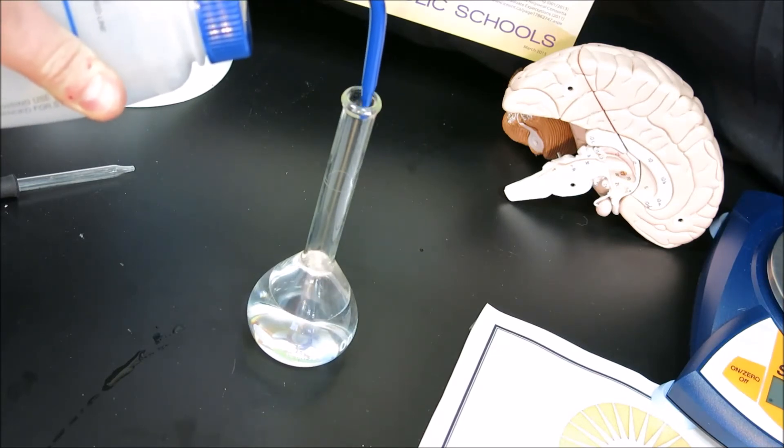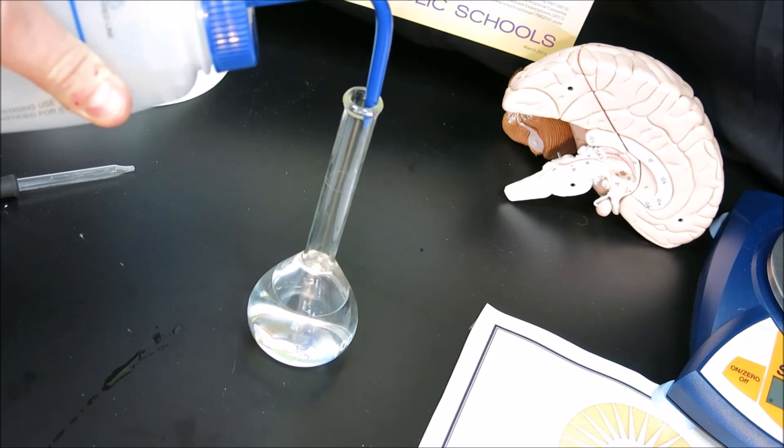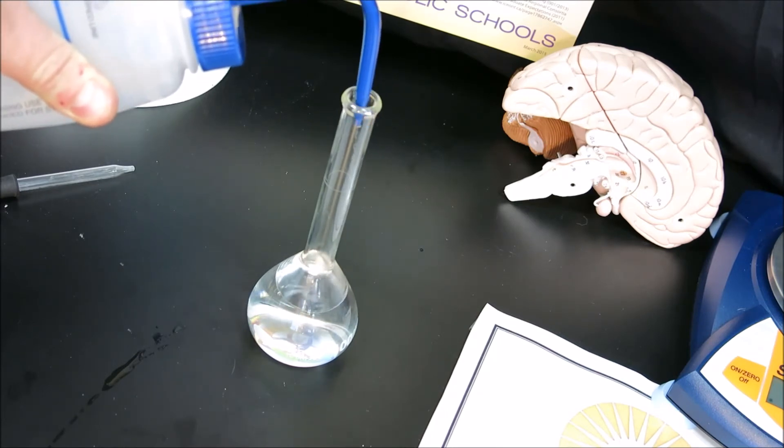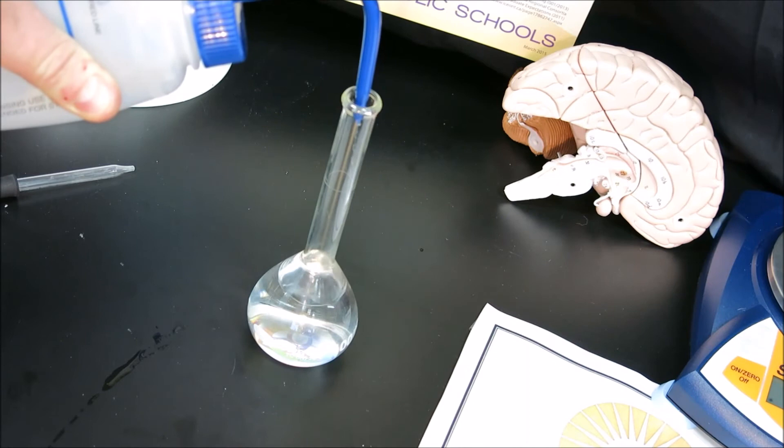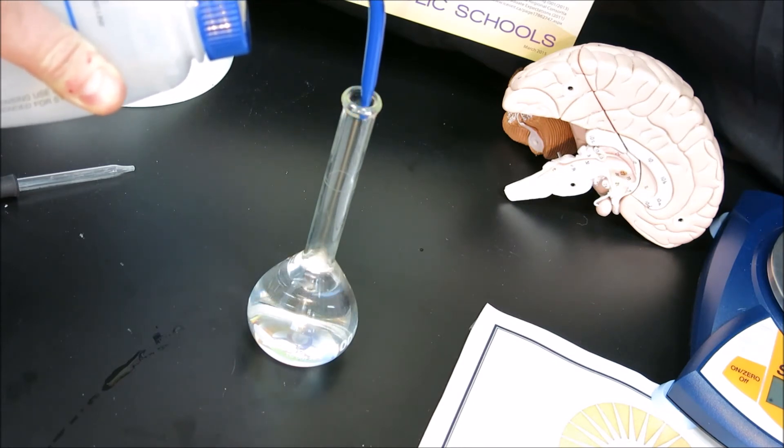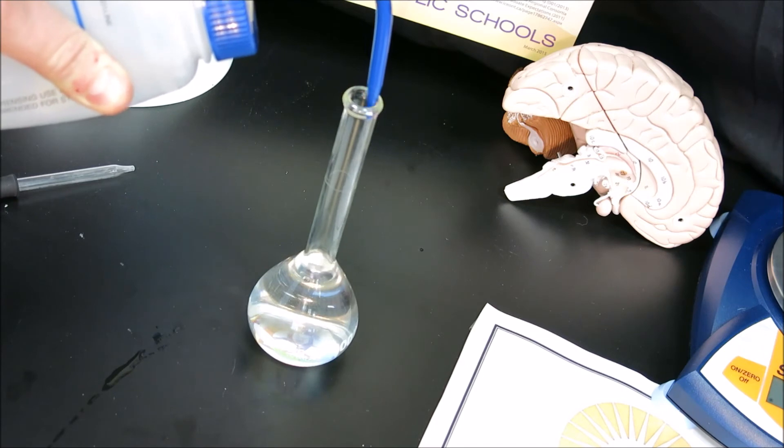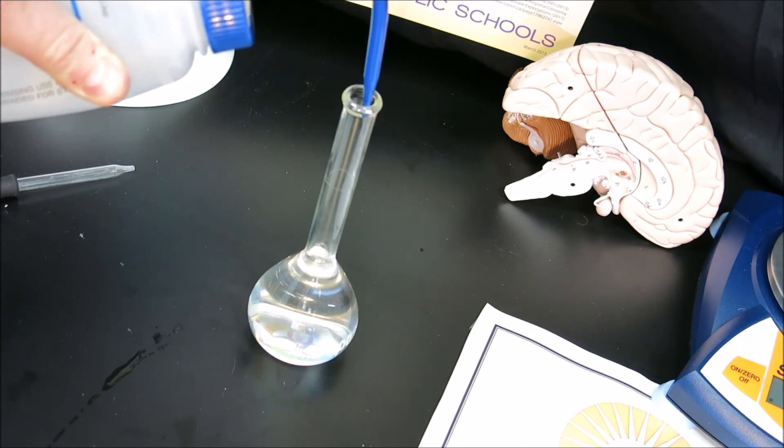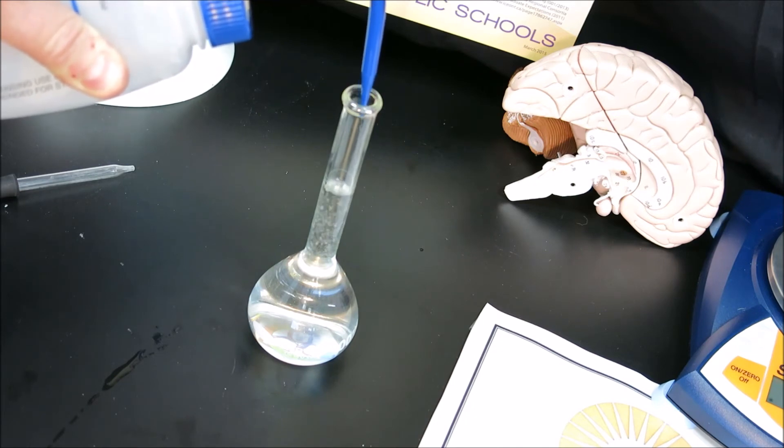As I squeeze at a constant rate, observe the change in the filling of the flask as soon as it enters the neck. Once it enters the neck, it fills very quickly, and we must take care not to overfill.